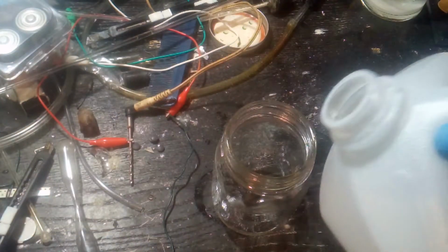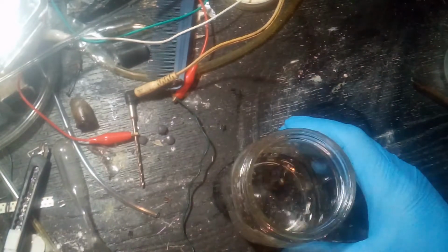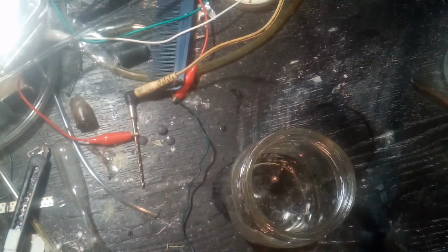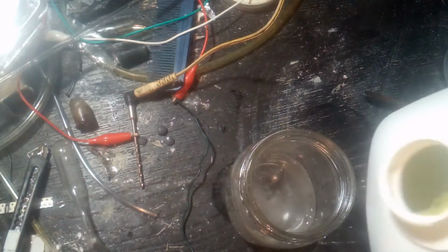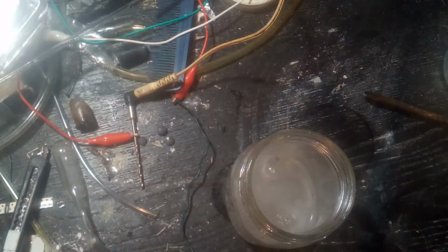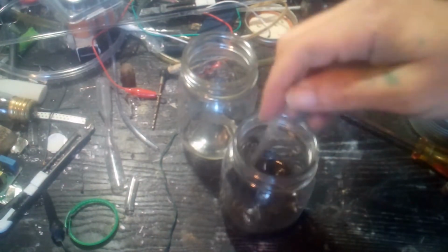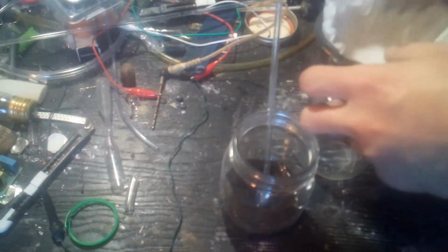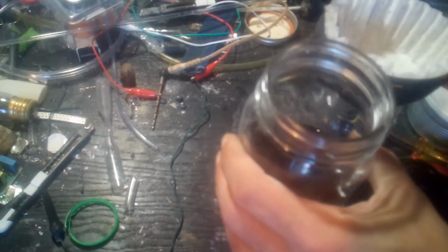To get the boron out, first I'm going to add some water. Just enough to cover this. There's already a little bit of fizzing going on. And I'm going to add hydrochloric acid, which will dissolve away the magnesium oxide. The products of the thermite reaction have had time to sit here and digest in hydrochloric acid for most of the day. All of the big lumps have, as far as I can tell, fallen apart. So it's time to filter this off and get the boron.